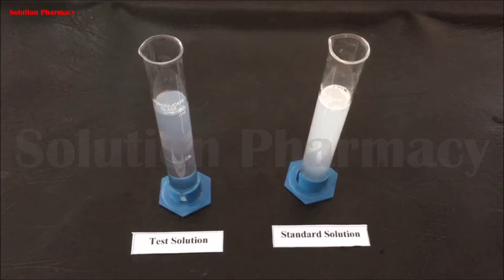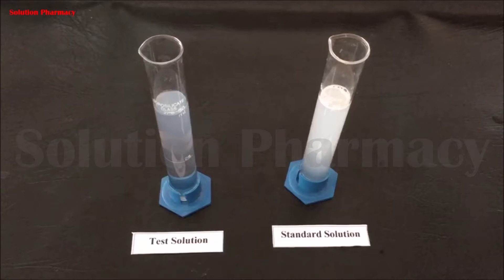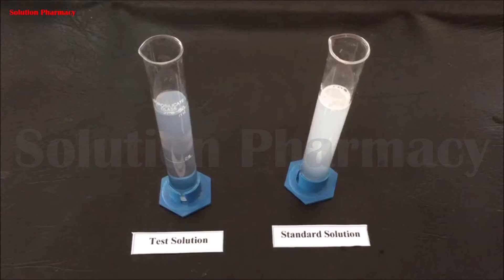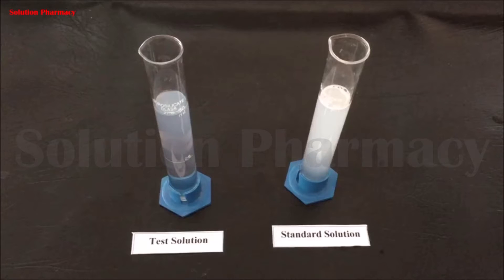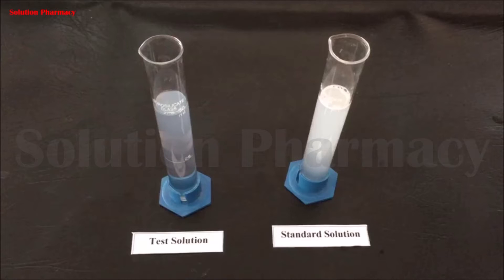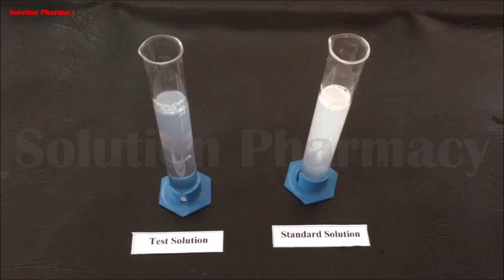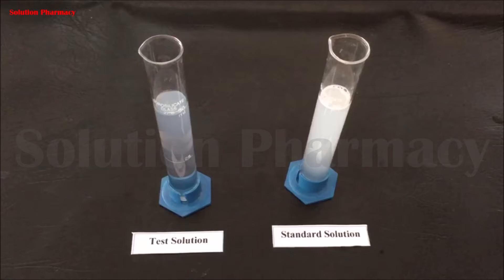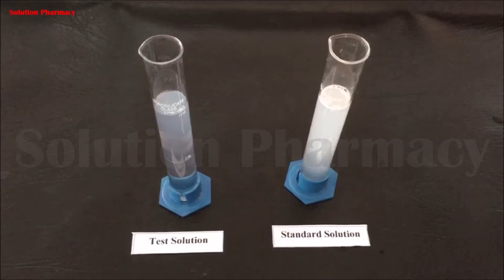Hello friends, welcome to the channel Solution. Today in this video we will show you how to perform the limit test of sulfate in a given sample. Before starting the experiment, let's know what is a limit test. Limit test is used to determine the inorganic impurities present in any chemical compound.